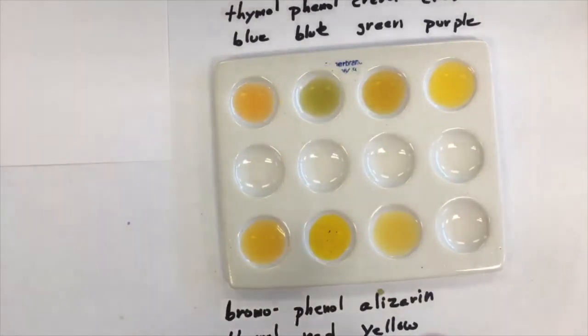I would say there looks to be like a little black dot in the phenol red. I think it's a maybe a little piece of rubber that broke off from the dropper, the eyedropper I was using for the phenol red. So just disregard that.